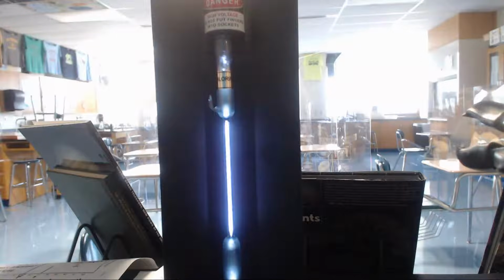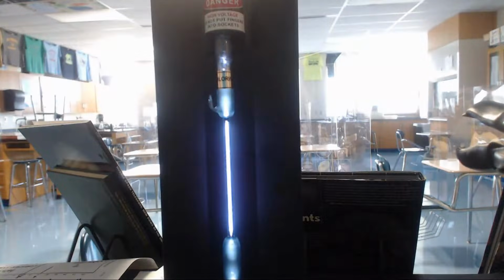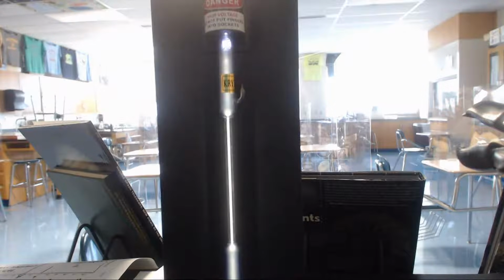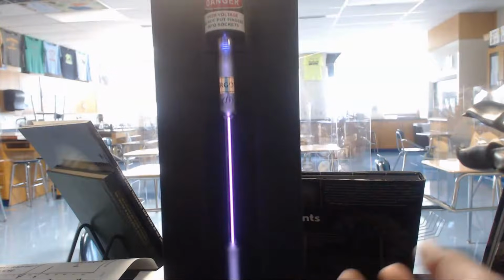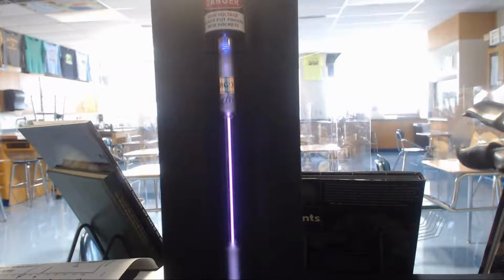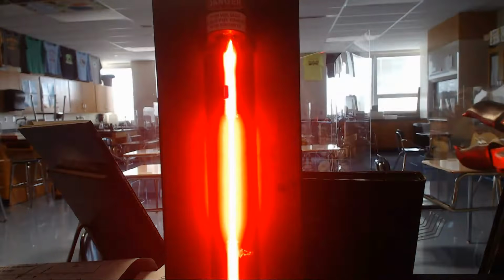Here's chlorine. Notice that it gives a purpley blue glow. Krypton is kind of this whitish glow. Argon gives this beautiful purple glow. I'm a huge purple fan, so this purple is my sort of color. One of the things the spectroscope will do is it will take this light and it will separate it out into atomic spectra.